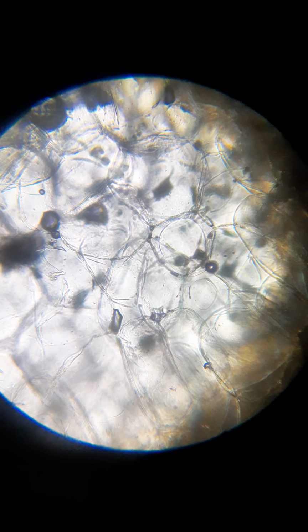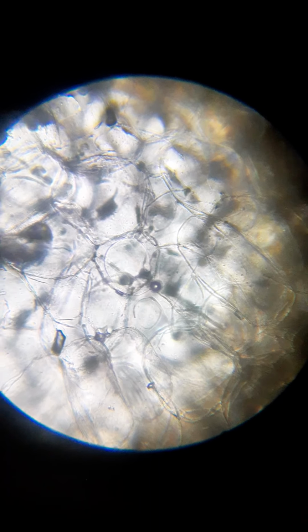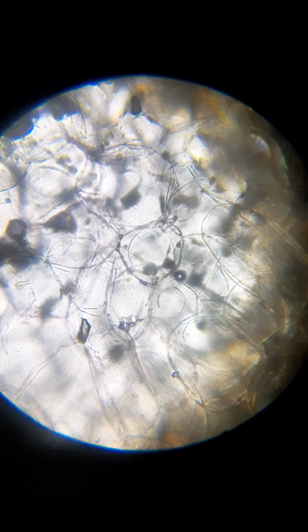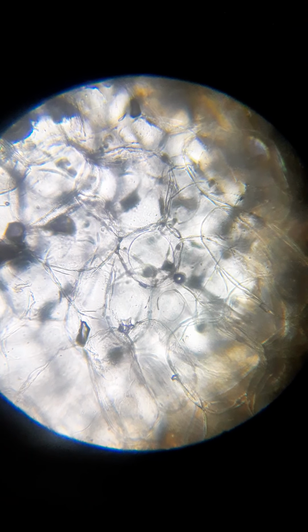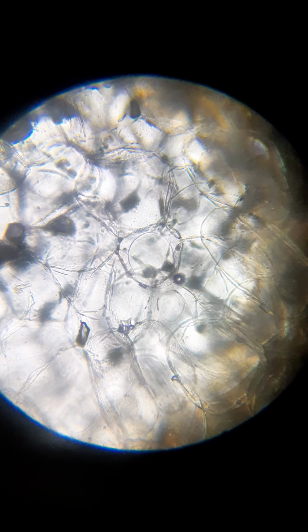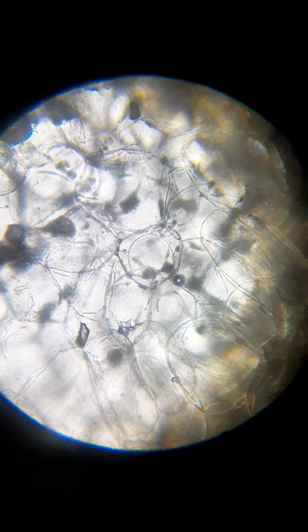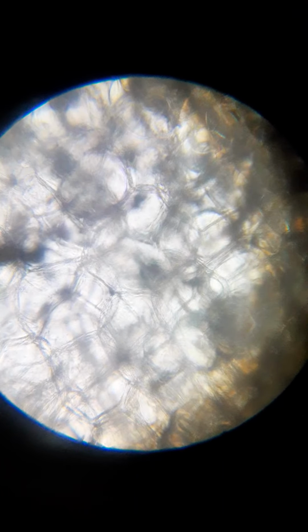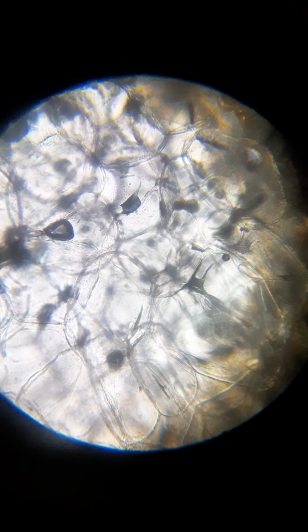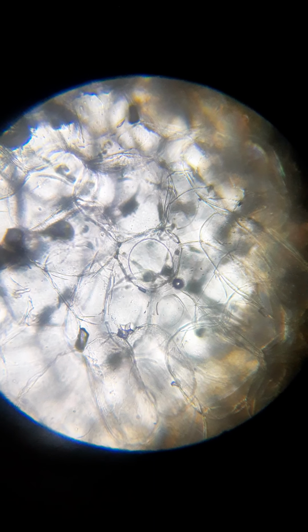All right, I'm going to put this right in the center here. Sorry, this took so long. Okay, I am not an expert at this. So right in the center there, you'll see a circle, dark band, and then you will see a light circle on the inside of that. Really quick, I'm going to zoom down because I want to make sure that that's not another cell underneath it or something like that. Okay, yeah, so that's definitely a cell wall there.